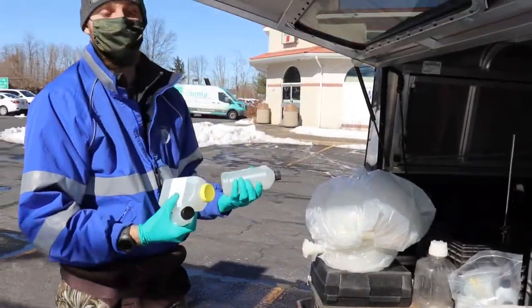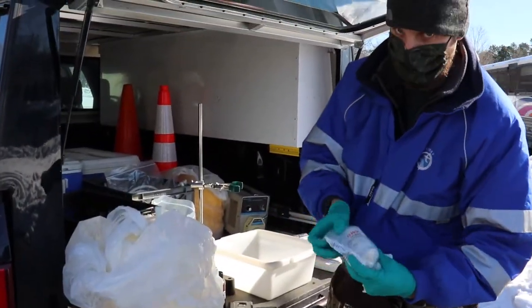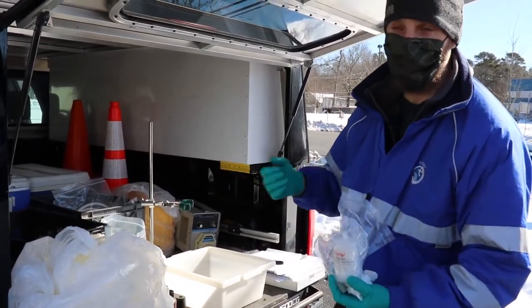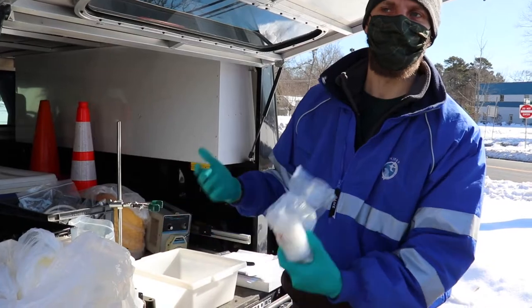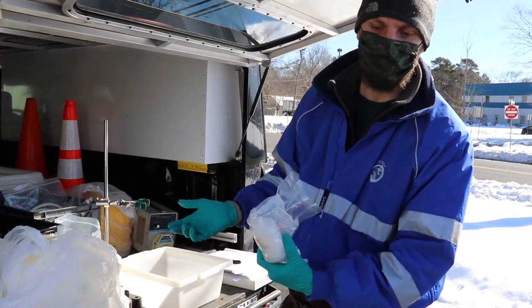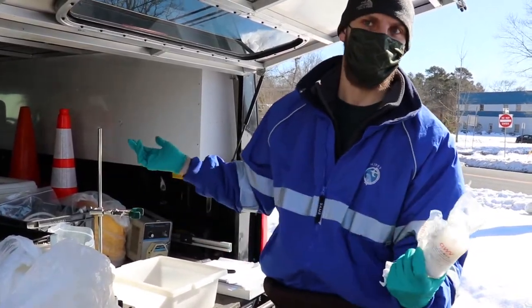Once we've collected the total samples, you want to make sure that you put them on ice. We're going to use a capsule filter to filter out these samples and get our dissolved parameters. The dissolved parameters are biologically available — the dissolved pollutants and parameters that we're going to be looking for are typically going to influence the aquatic life of the stream more easily: the fish and macroinvertebrates.